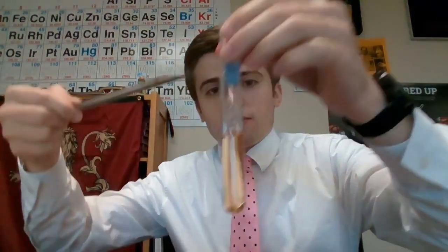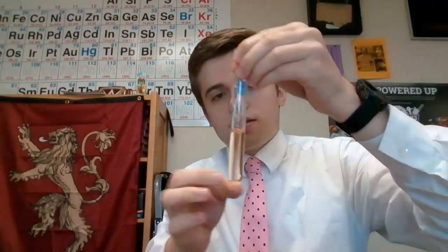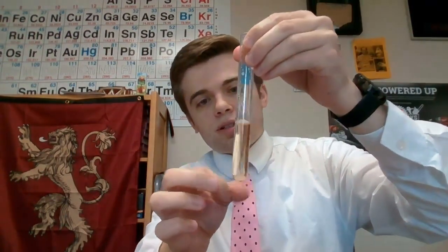And then for our last test tube, test tube number 4, we're going to add a little bit of solid potassium chloride, which I have right here. We're going to add it to our solution and see what happens. We're going to want to make those same observations. So what changed? And then tell me once again what direction did equilibrium shift. I'm going to hold it up here so you can see how it has the color. I put it in. Flick it, make sure it all dissolves, or as much as possible.